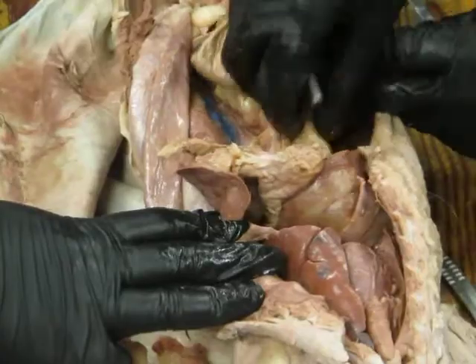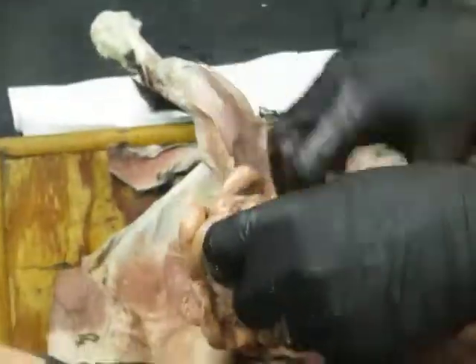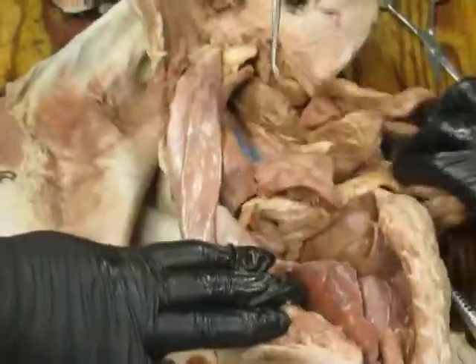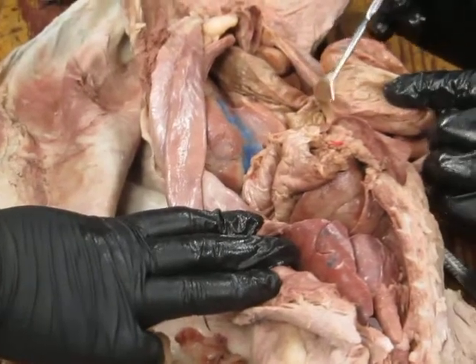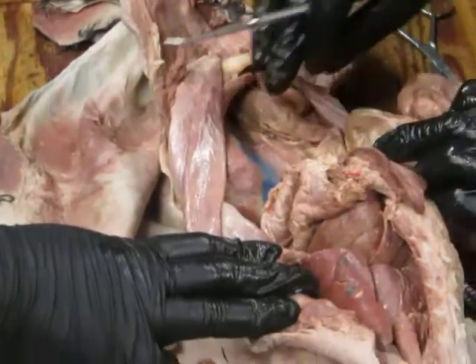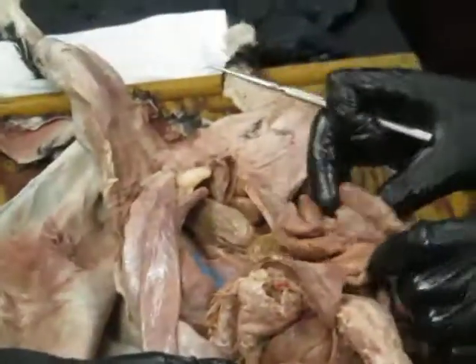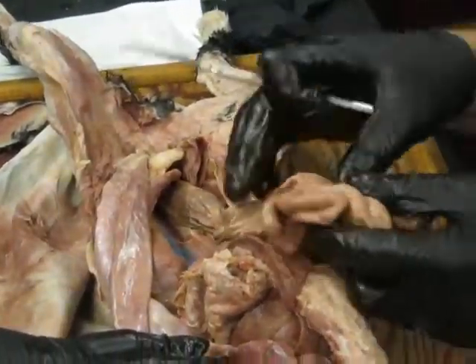Okay. And then the small intestine continues along, and there is a mesentery associated with the small intestine connecting to the dorsal body wall here. That mesentery is called the mesentery proper. Yes, I don't like the name, but that's what it's called. Eventually, the small intestine, which is reasonably long here, is all coiled up. It's got a nice mesentery.